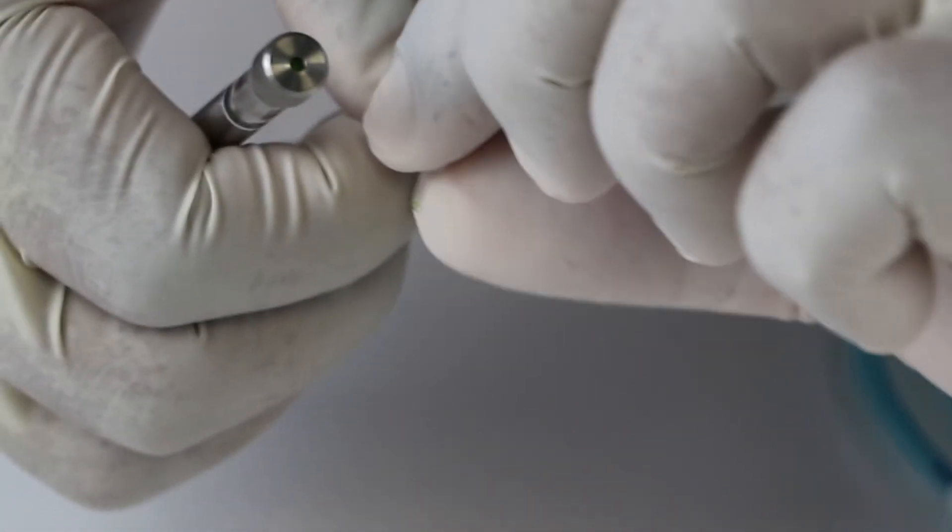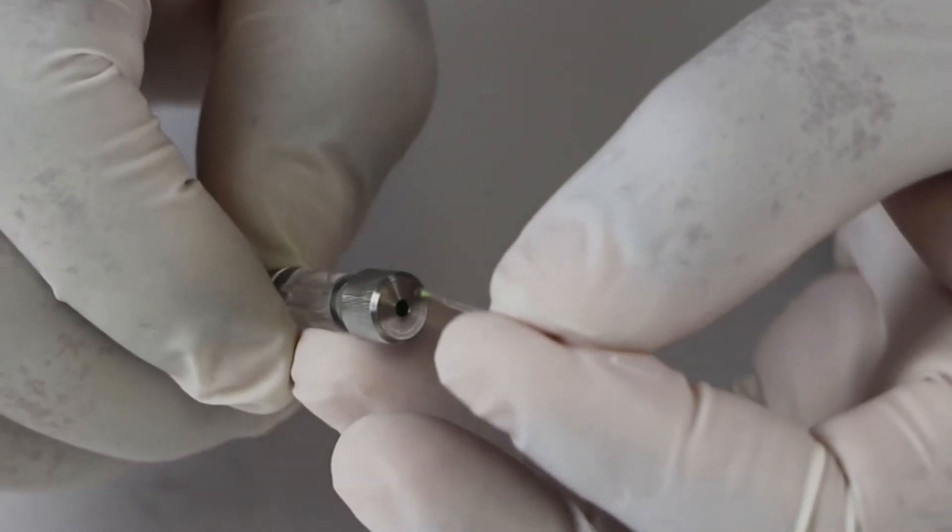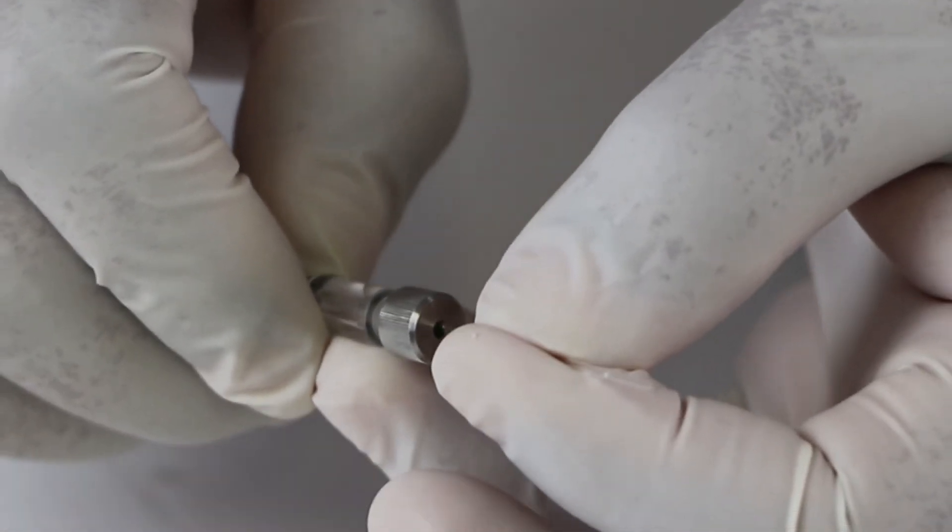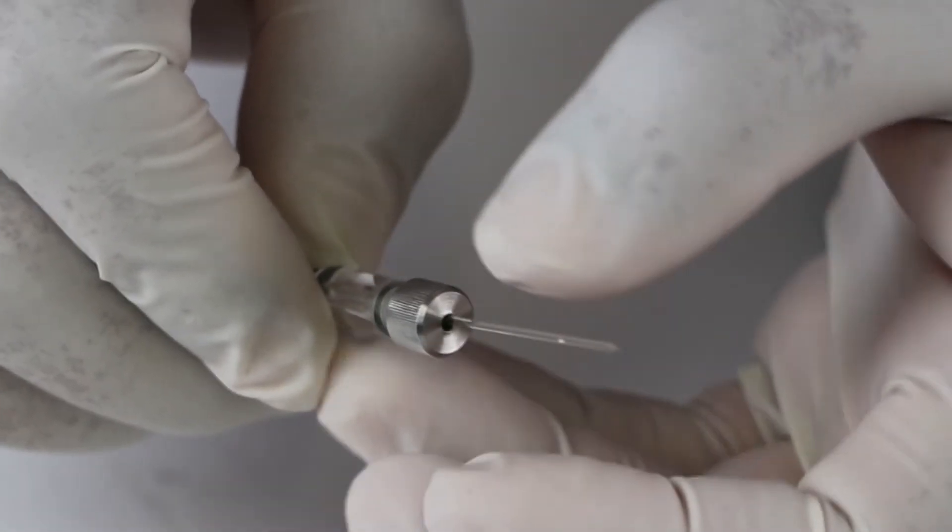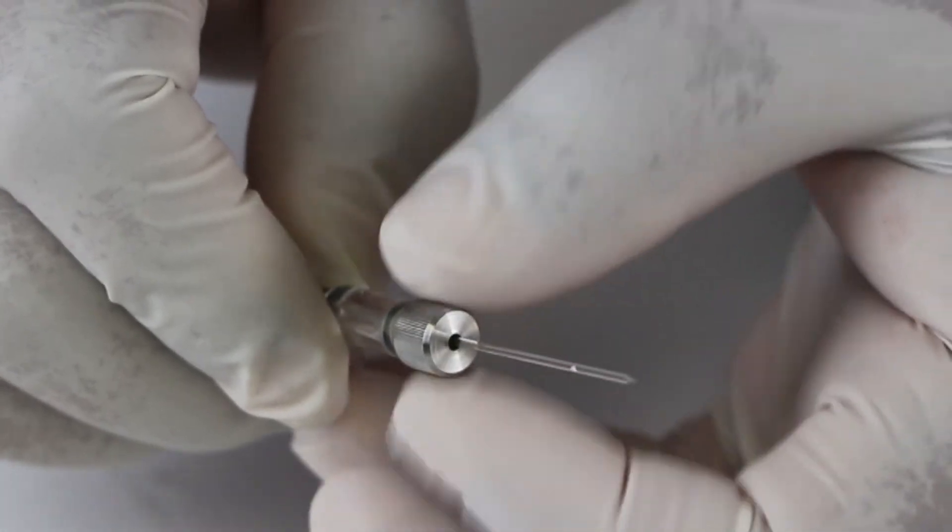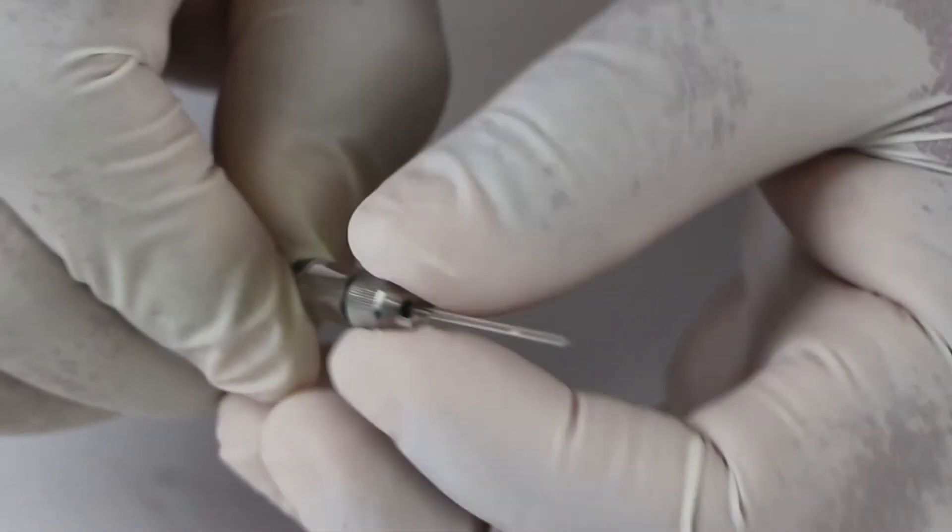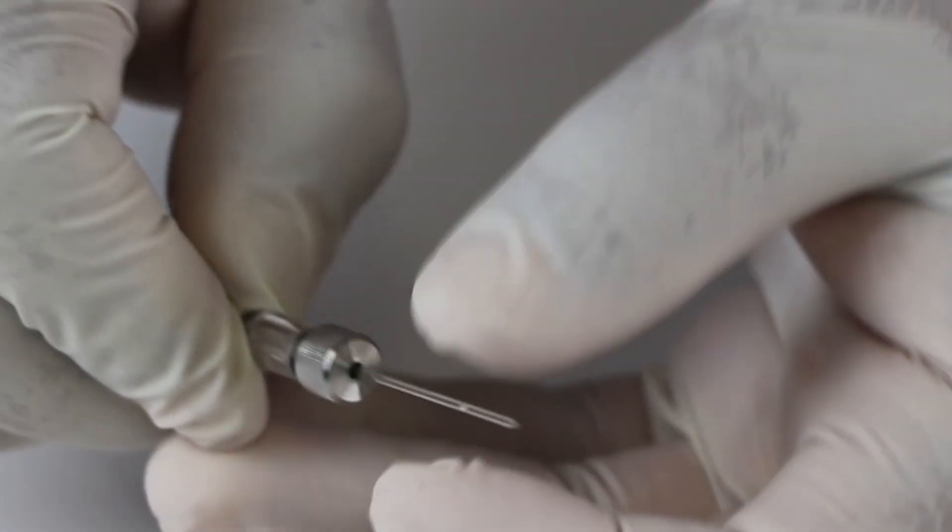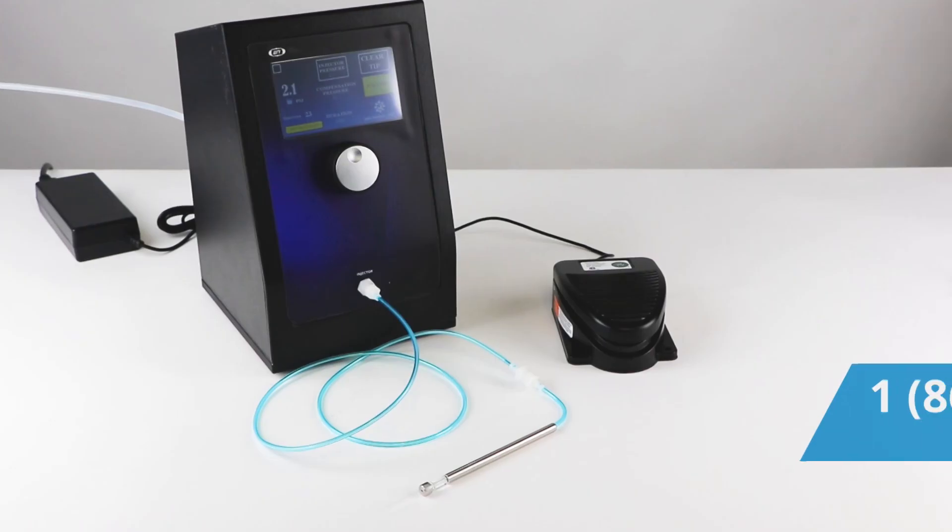Now insert the blunt end of the micropipette, that's the pre-pulled capillary glass, into the cap through the gasket and into the body. Screw the cap in place. The screw cap and rubber gasket firmly hold the glass micropipette.